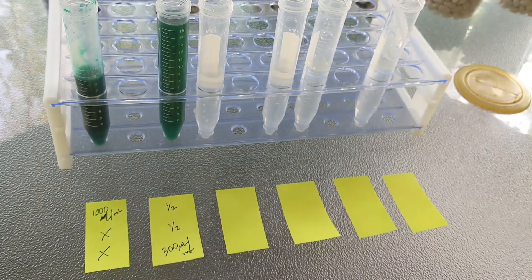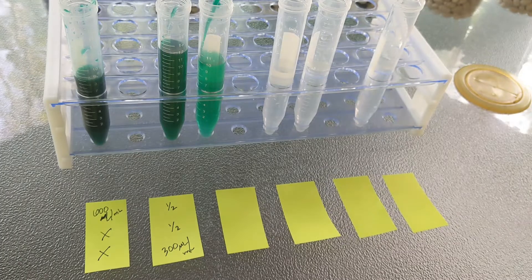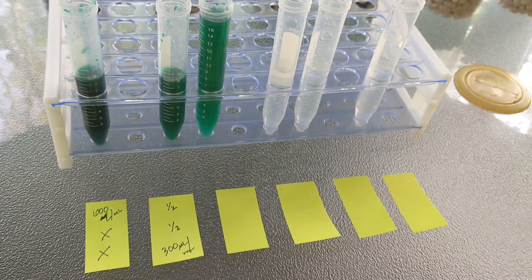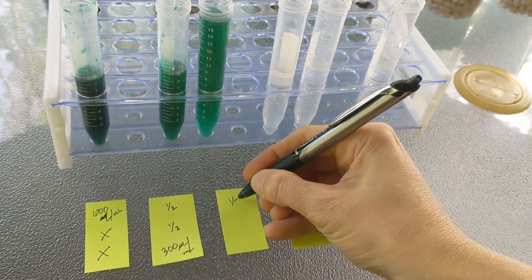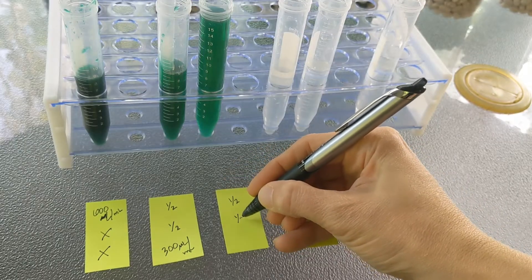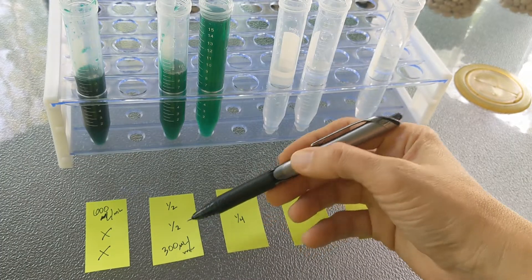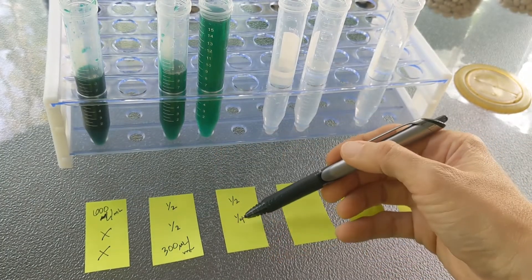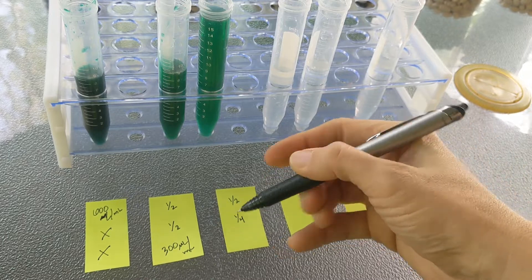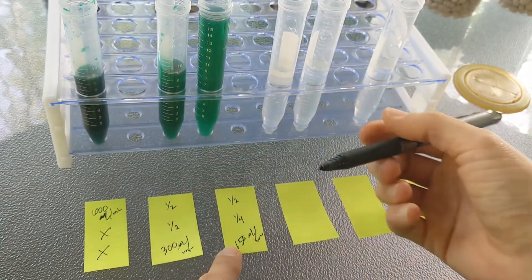Now we do the same thing starting with the tube that's already half as concentrated, because that's how a serial dilution works — each tube gets less concentrated, and if it's color-based, each tube gets lighter. This one again has a tube dilution of one-half, but now the final dilution is this tube times the previous tube: half of one-half is one-fourth. You just multiply the fractions. There are two ways to do this: take half of 300 (our last tube) or take one-fourth of 600. I prefer tube by tube, so half of 300 is 150 microliters per milliliter.